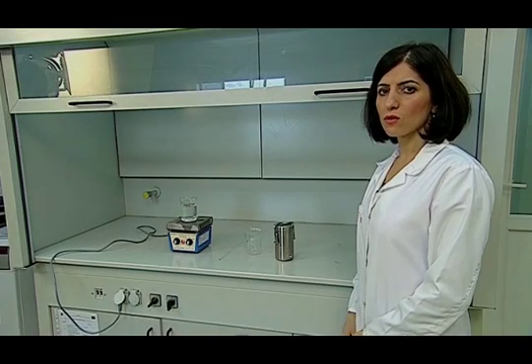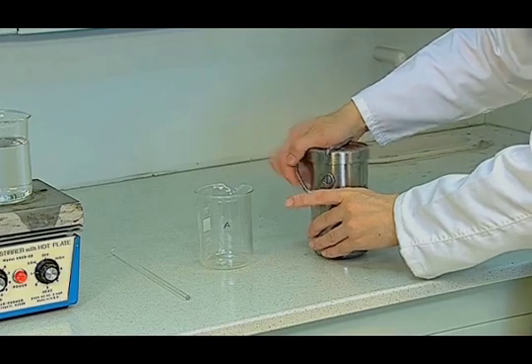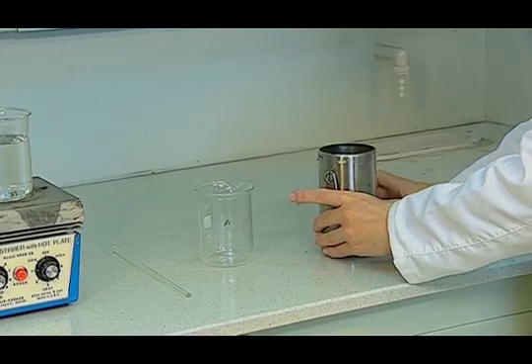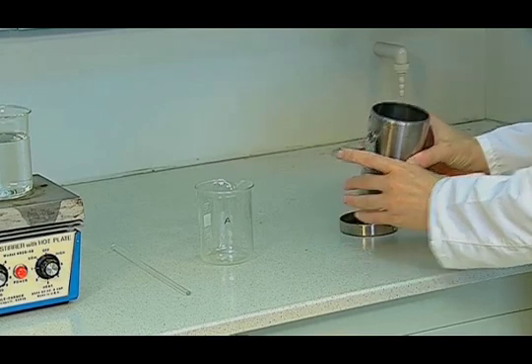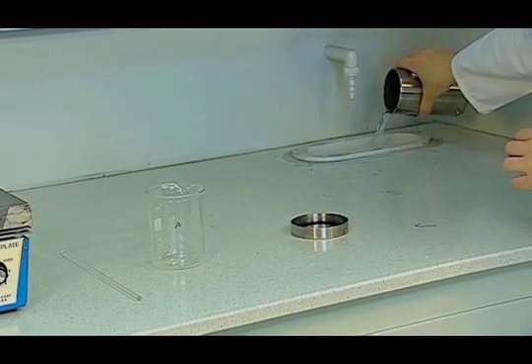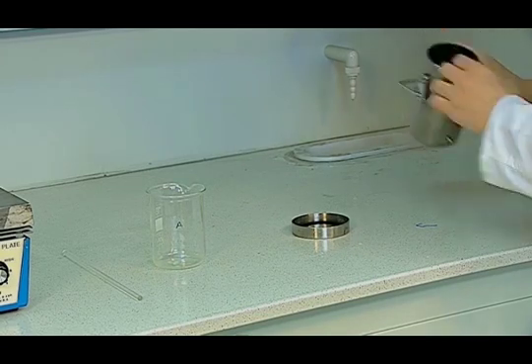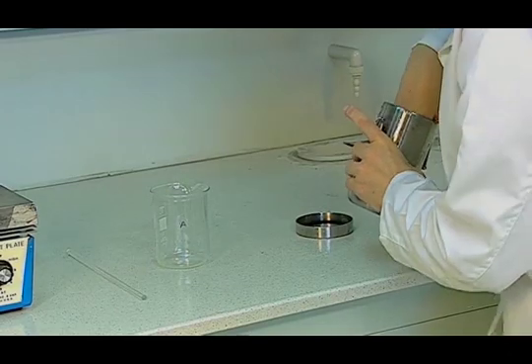The washing fastness sample is removed from the container. Then, the excess water is discharged. It is put in the beaker to wash off.